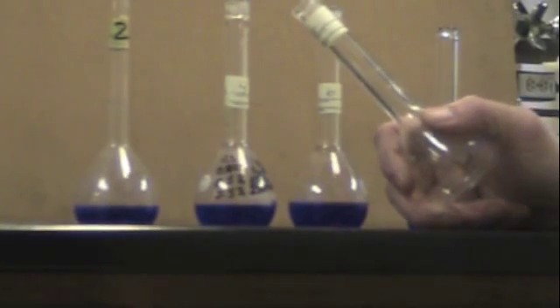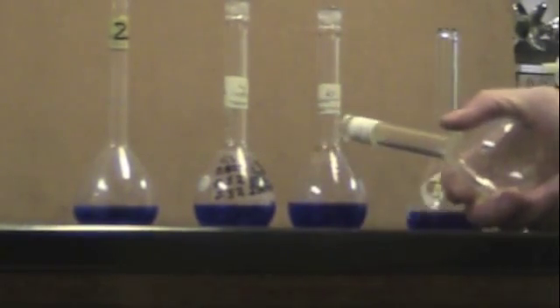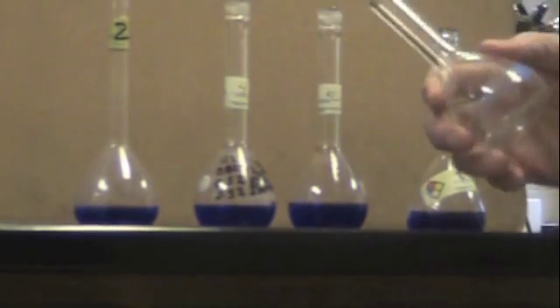Now what we're going to be doing in this step is diluting our solutions to 100 milliliters. These volumetric flasks are kind of useful because you can't really screw these up as far as measuring to the wrong line because they only have one line on them. And if you dilute or fill this flask up to the line, guess what, you have 100 milliliters. So what you're going to do is using a bottle of distilled water, you're going to add water until you've diluted your sample to the 100 milliliter mark. The only thing you've got to be careful of here is don't go over the mark because if you go over the mark you have to start all over again.